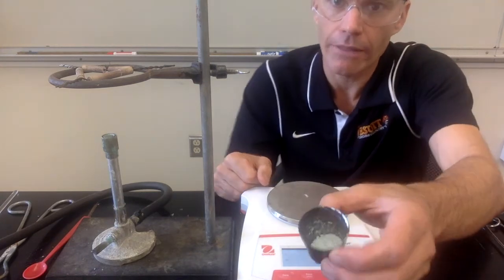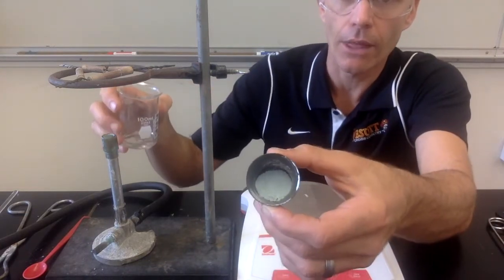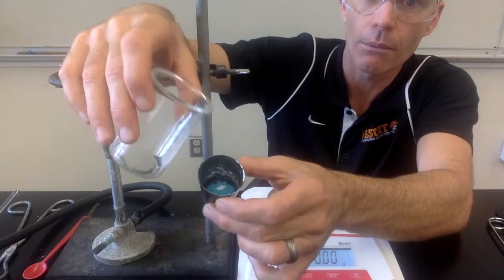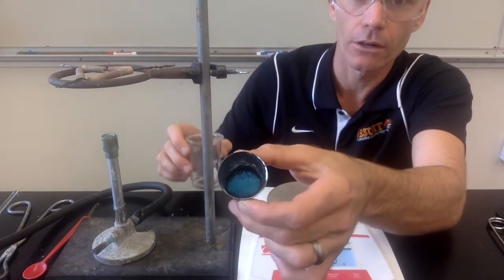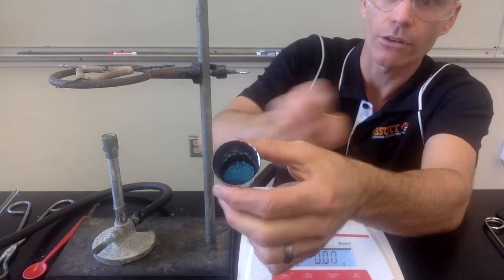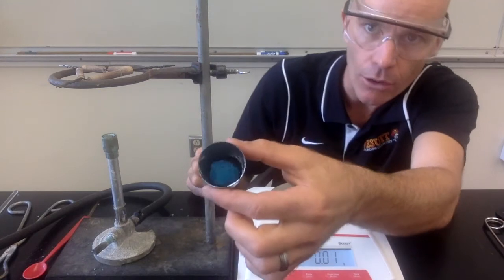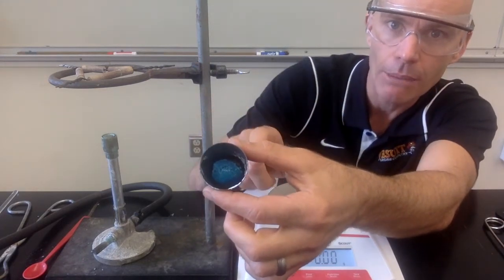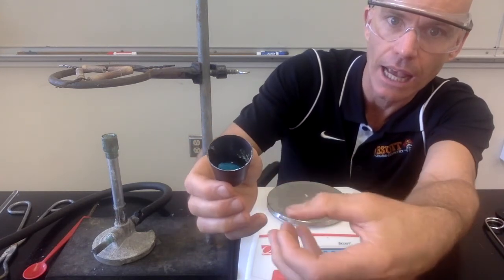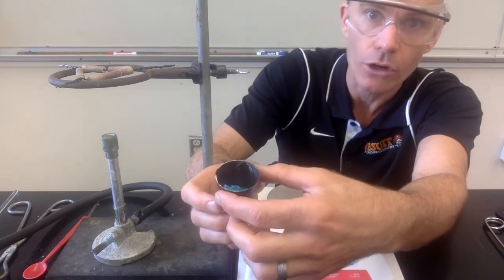There's one last thing I'm going to do, and that is to add water back to the hydrate. You can see it's that white-gray powdery color. When we add the water back to it, you can see it turns back to that bright blue color we had initially. It's a reversible reaction. I'm also noticing right now that this is actually getting warm — it took heat to drive the water out, which was an endothermic reaction. Now when I put water back in, the opposite reaction is exothermic. The crucible is actually getting warm as that anhydrous salt takes in that water again and gives off heat.